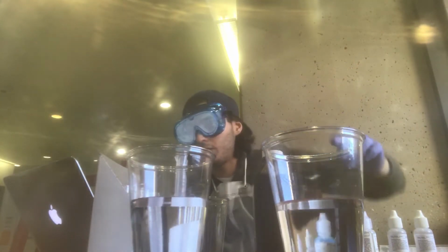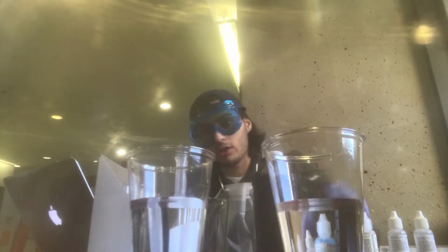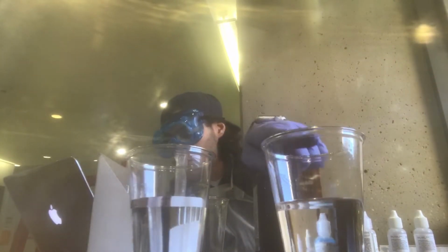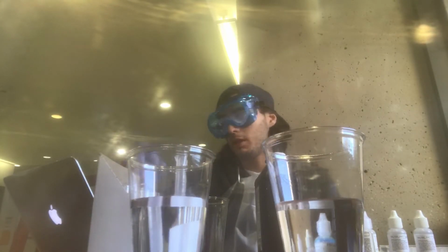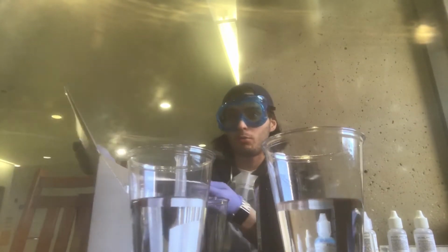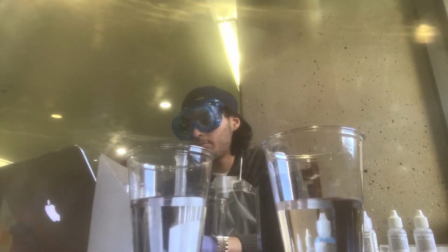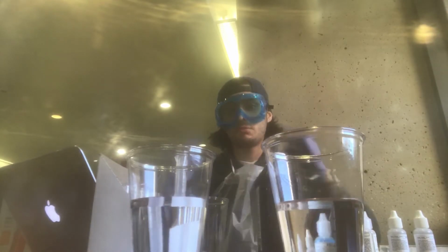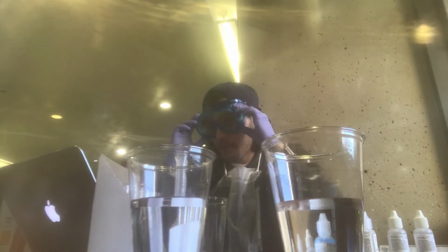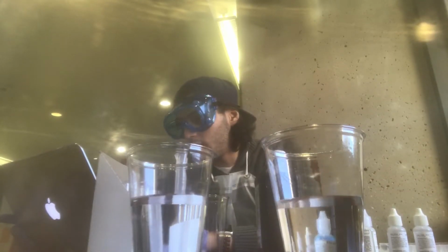And we also have ice right here. I've already put it in this cup right here. And we've got the warm water right here. And then we have the pure water right here. And for the timing, I'm going to use my laptop. I have it open right here for the timer or a stopwatch. Okay, and I have my goggles on, my gloves on, my apron on for safety. And we've already disinfected the table and we're good to go.